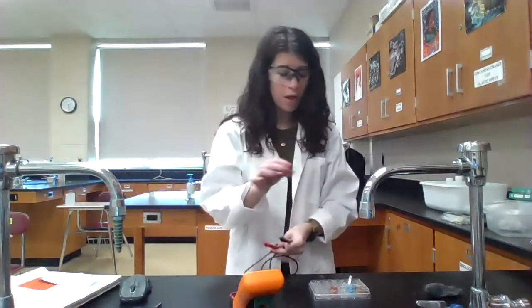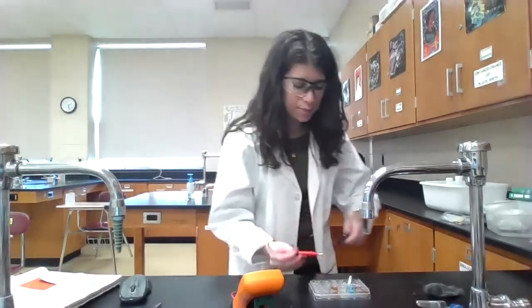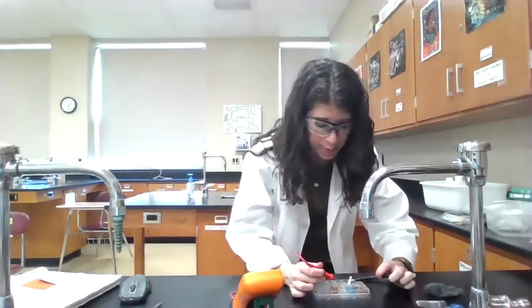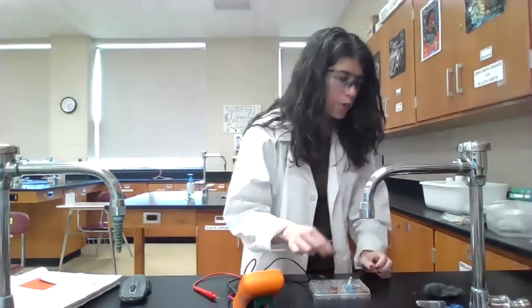So that means there is a greater difference in potential with the zinc and the silver compared to the zinc and the copper, because I'm getting a higher number. So again, you just try to do the best you can, get good surface contact, and then record the voltage there. So as I mentioned, we would do this for every cell combination with zinc, okay? We would test the zinc with the iron, with the magnesium, and with the lead as well, in addition to the copper and the silver.